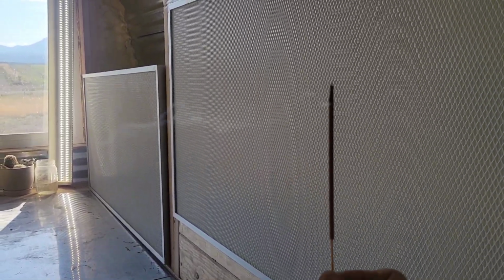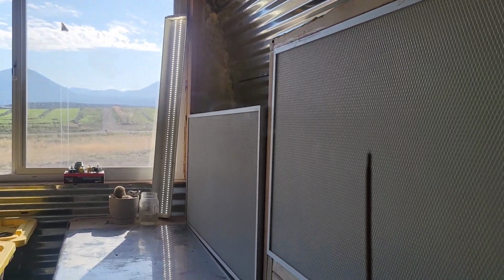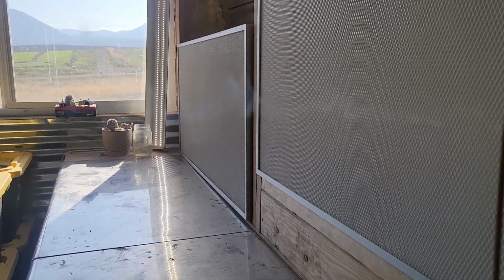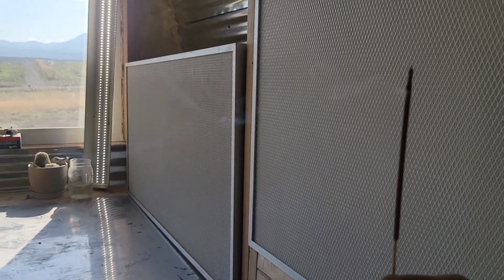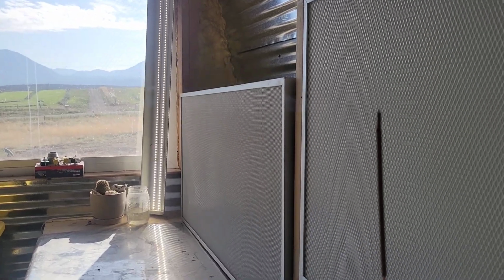But the smoke is basically coming off the incense stick. And this is actually a pretty nice angle. There you go. Look at that. Laminar flow. How cool is that? And if you guys notice too, this is the perfect height. It's like this all over the filter. As long as we're in the airflow, it stays like this. So cool though, that you can see. All right, so there we go.